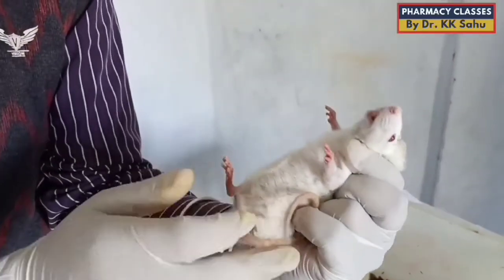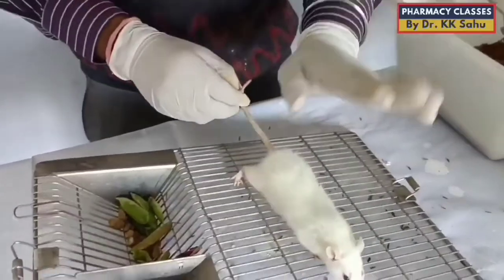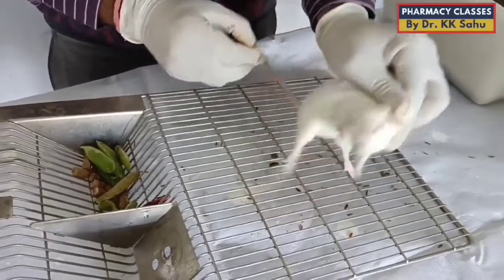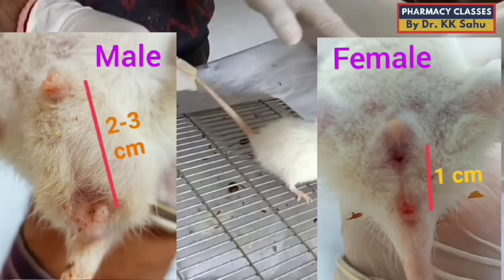One more difference in case of female rats is the presence of mammary glands. These are more clearly visible while they are lactating. Now we can see it in another female rat — here you can see the hairless spot, which is actually the mammary gland. So these are the basic differences between male and female rats according to their genital organs.